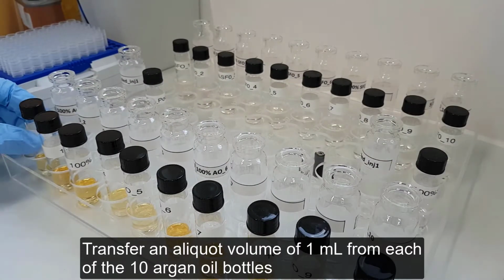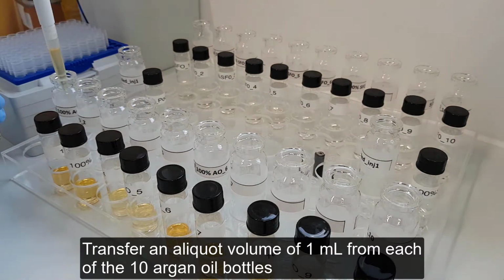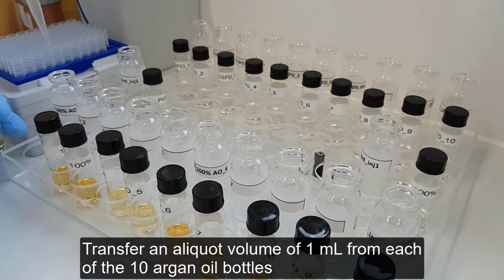Transfer an aliquot volume of 1 ml from each of the 10 argan oil vials into 10 individual empty headspace vials.